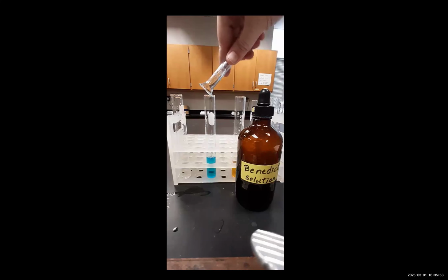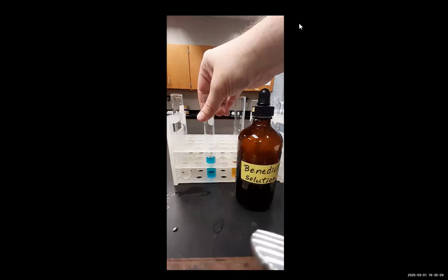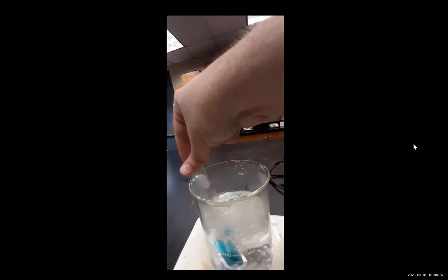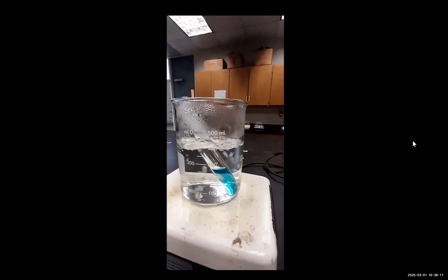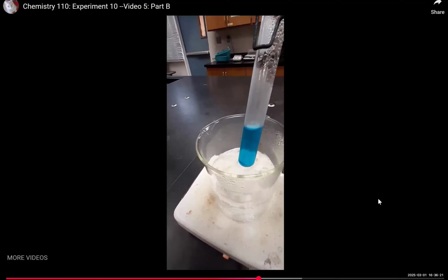And remember, you have to heat this solution in order to make a definitive assignment as to whether it's a positive or negative test result. To this end, the sample is moved over to heating. As you can see, after extended heating, there is no color change.